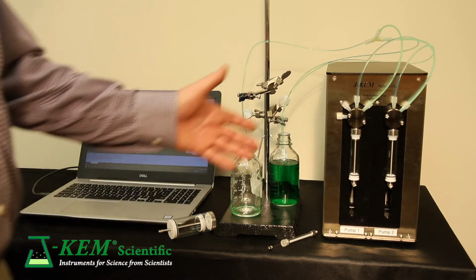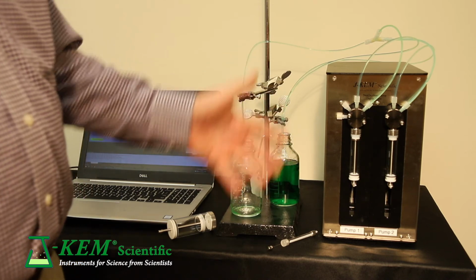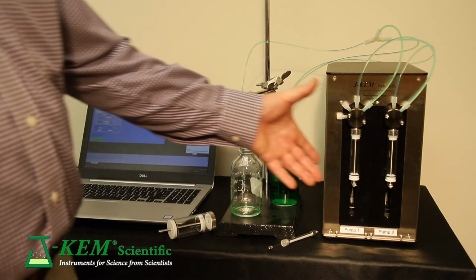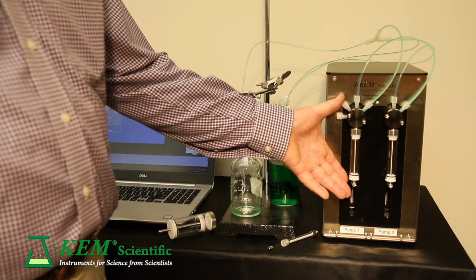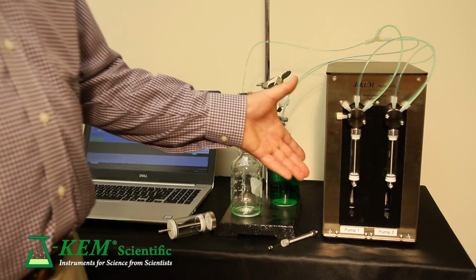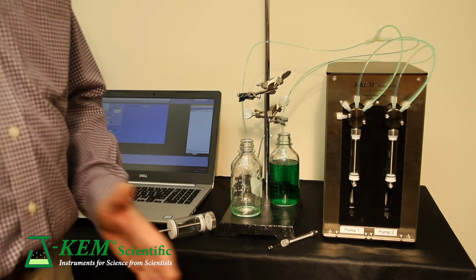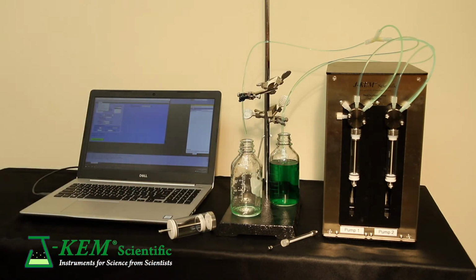And as I said, you can get them available in single or dual or mini sizes. I'm going to first run a demo using just a single pump so you can see how they add. And once you see how the single pumps add, then you can watch and see the difference between a single pump and a dual pump addition.